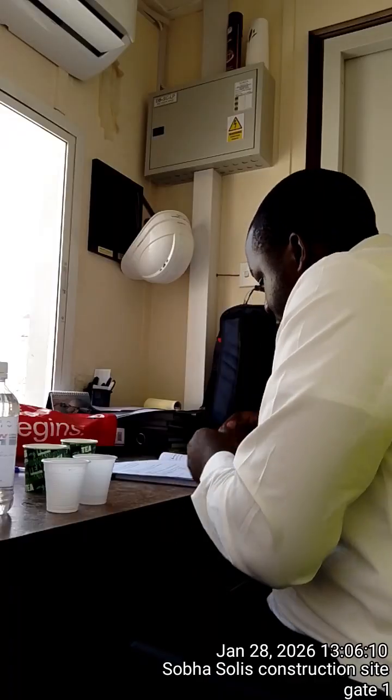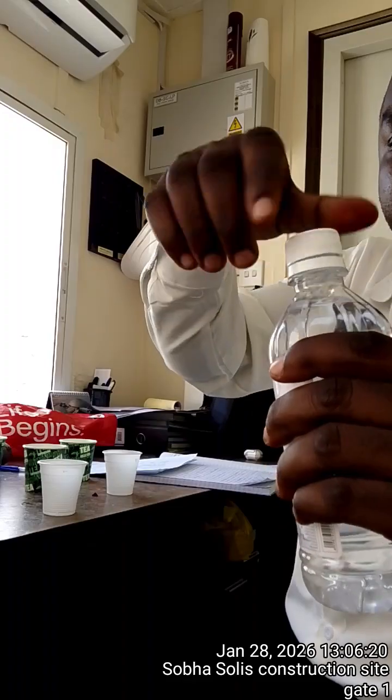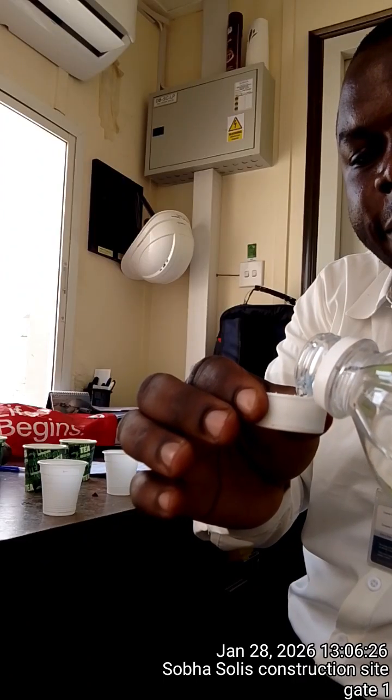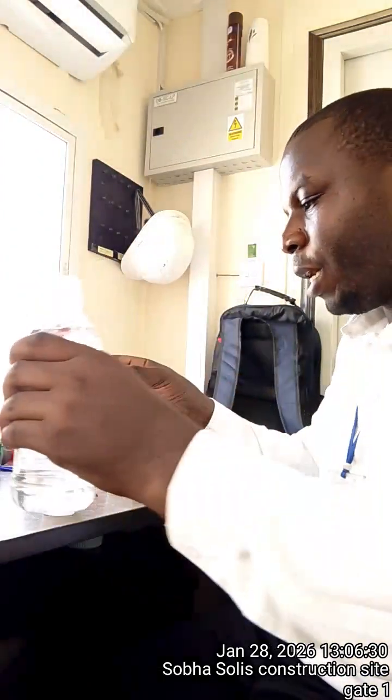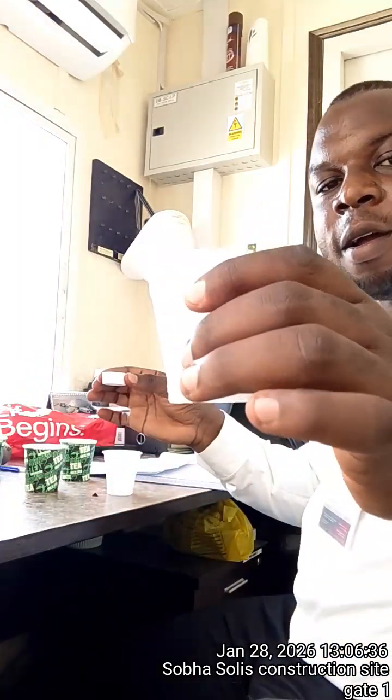So my procedures, and the procedure number 1 tells us to add few drops of vinegar to the sample. So this is my vinegar, and the drops I'm going to add. To avoid spillage, don't pour it around your body, and make sure you have a well ventilated area. So my vinegar is here. I'll start with the drinking water. I add few drops and make my observation. So drop 1, 2. So I only added 2 drops.